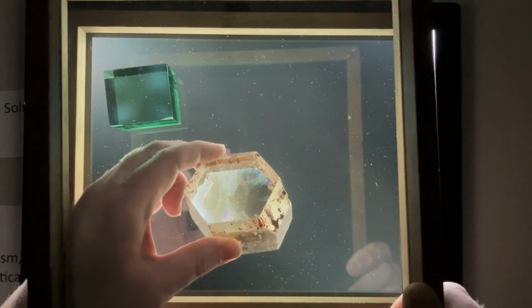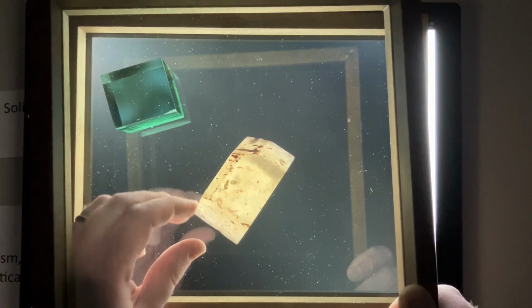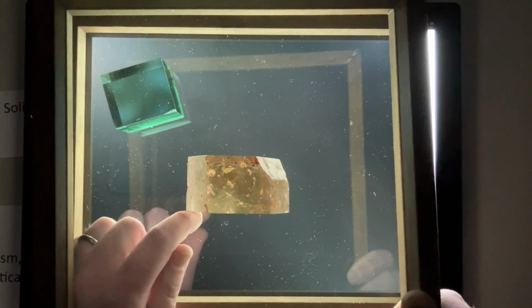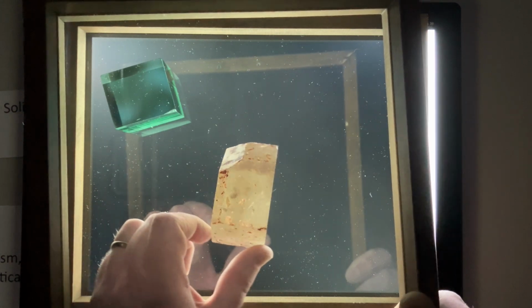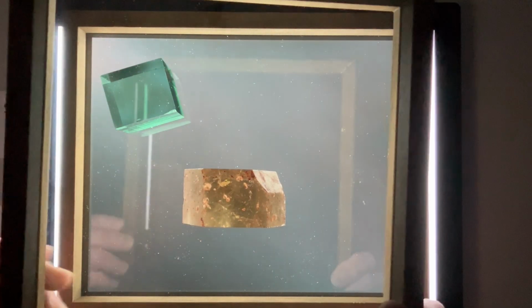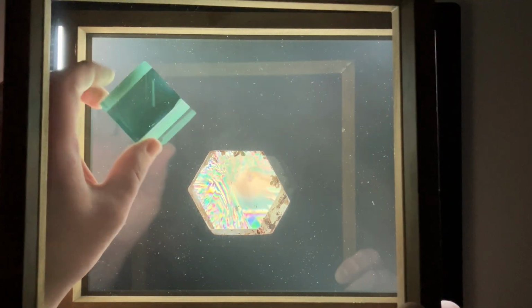When we reorient the crystal to look down the plane of the A-axis, however, you'll notice a very different behavior. In this orientation, the crystal is primarily dark, but as we rotate it, it transmits light, and then we can rotate it to go back to darkness. So this is the extinction and transmission of light, and this is once again caused by that quartz crystal structure, and how that quartz crystal structure is aligning with the vibrational directions of our linear polarizers.